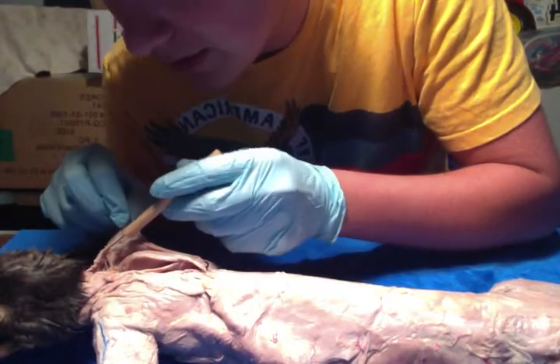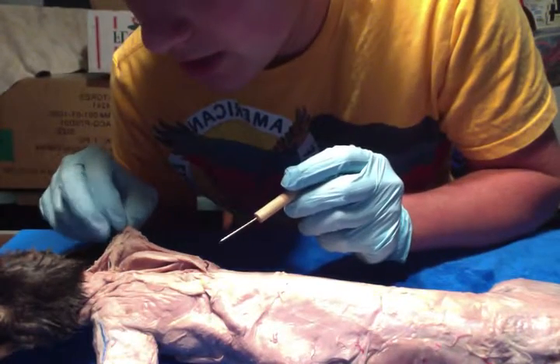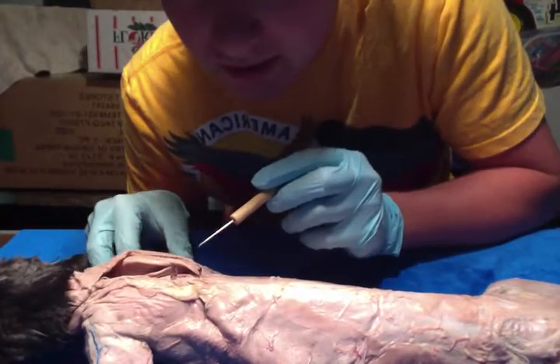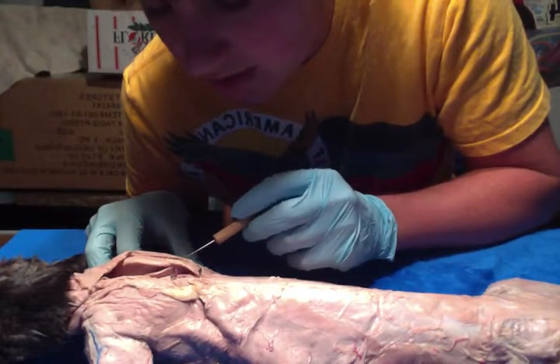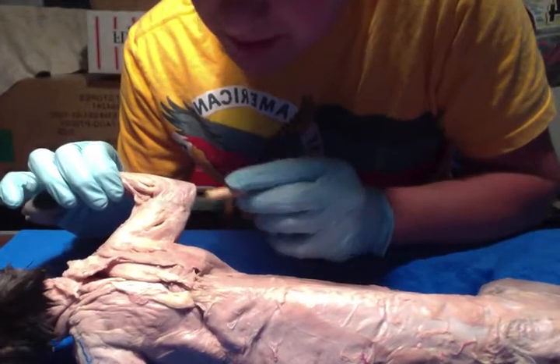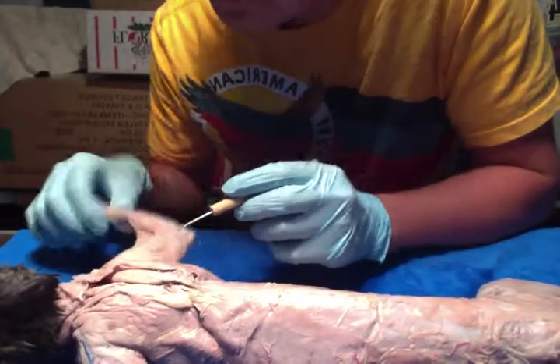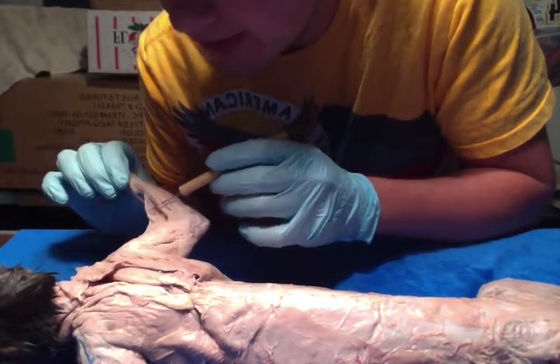And then we have your levator scapula ventralis, which draws the scapula cranially. And then right here we have your spinodeltoid, which does the same thing as your acromiodeltoid, so it flexes and rotates the humerus. Right here we have your triceps brachii, so you have your long head and your lateral head, and the triceps brachii extends the forearm. And then right here you have your brachialis and then your brachioradialis, and they both flex the forearm.